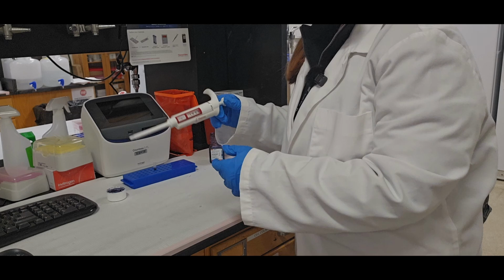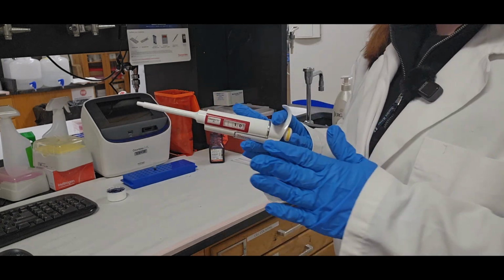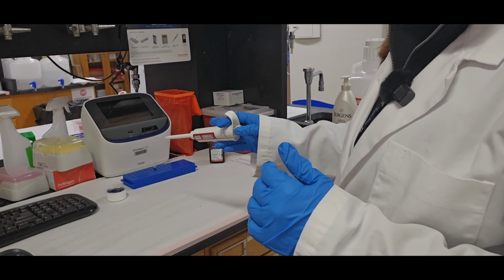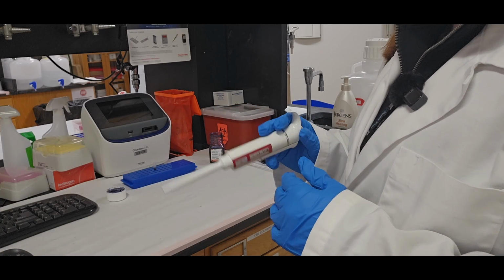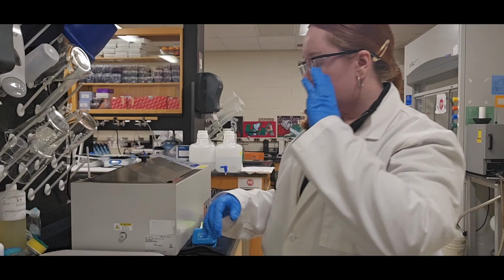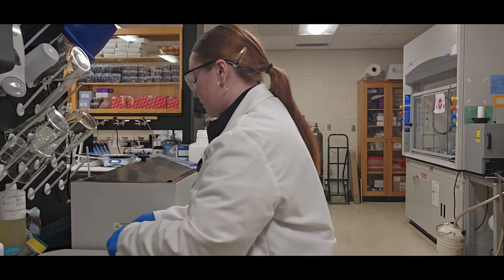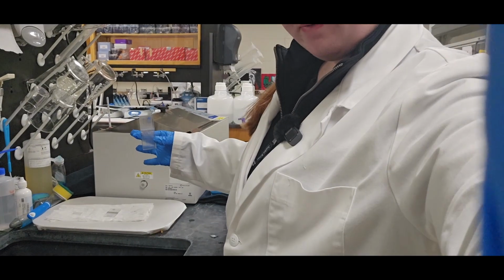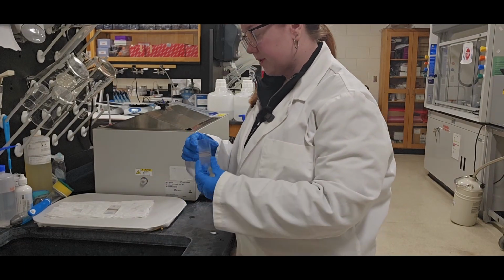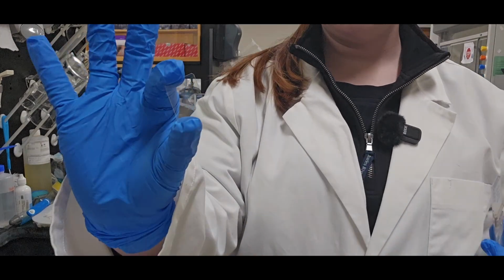Then you're going to change this micropipette to say 10, because this is actually how much goes into your cell counting chamber on the cell counting slides if you're doing automatic, or in the hemocytometer for manual counting. I'm going to manually count first so we can talk about the math before going into automatic counting. Two clean hemocytometers are kept by the sink in the mammalian lab, and that is the hemocytometer itself, and a glass slide as well. Be very careful not to break these.